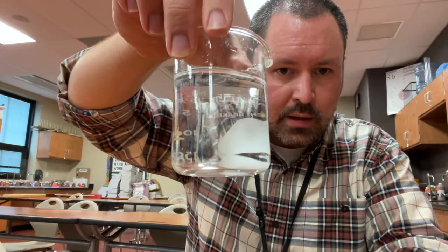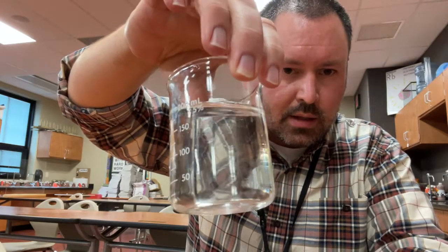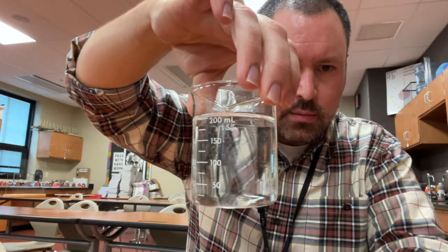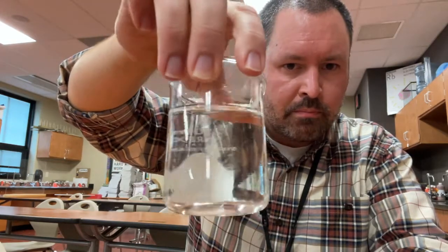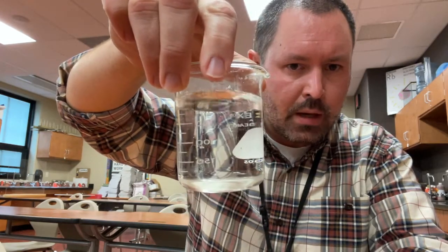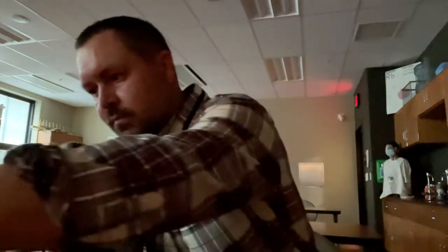First off, I believe is the sugar water. So the sugar water is right here, and you can take a look. I should probably have a white background behind this or something like that, but take a look at the sugar water and tell me what you think about the appearance of that. I have the lights off so the Tyndall effect can be seen a little bit easier. So let's go ahead and go one by one and take a look at the Tyndall effect on each one of these mixtures.